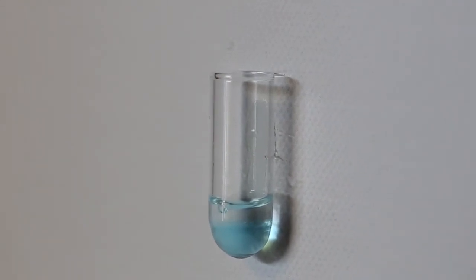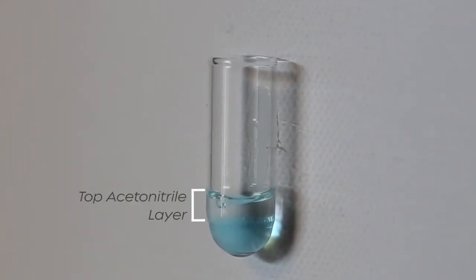The top layer is the clean acetonitrile with the compounds of interest. This solution can be separated and analyzed directly or after dilution with water.